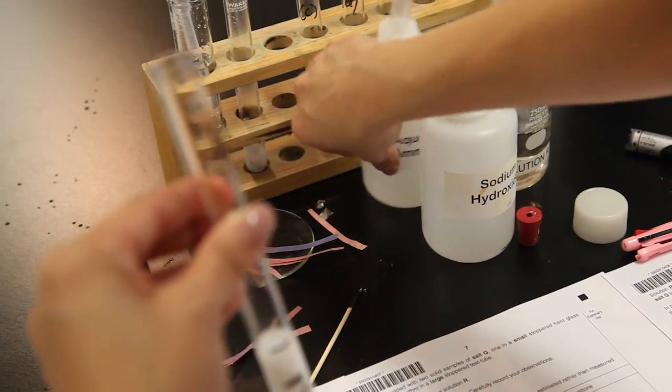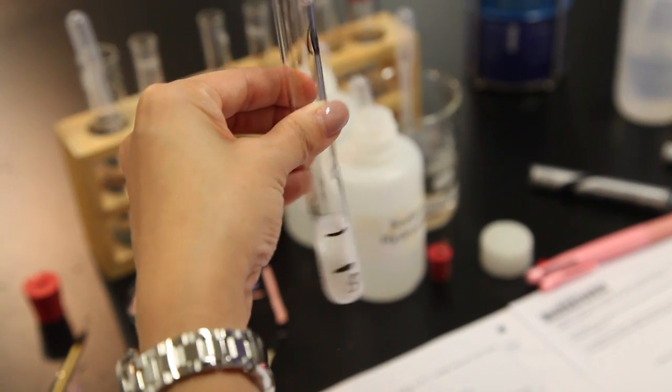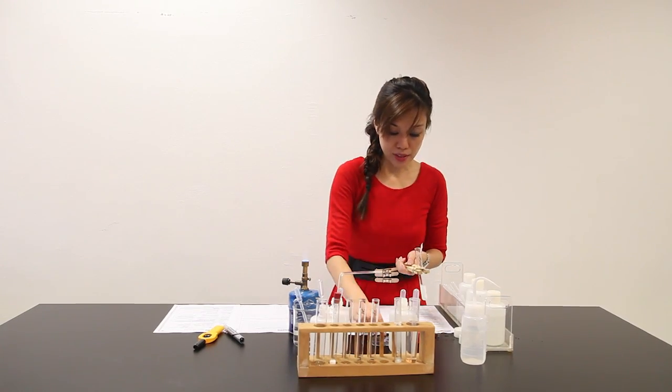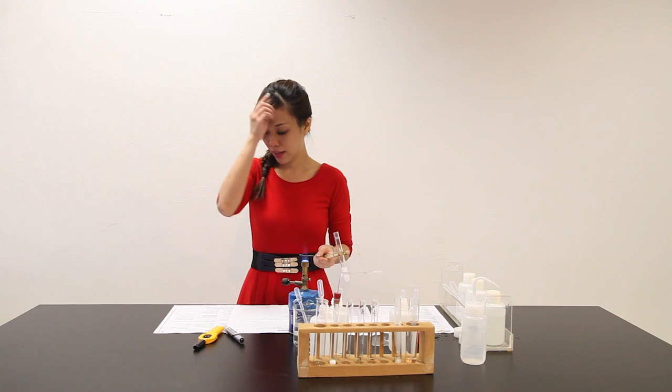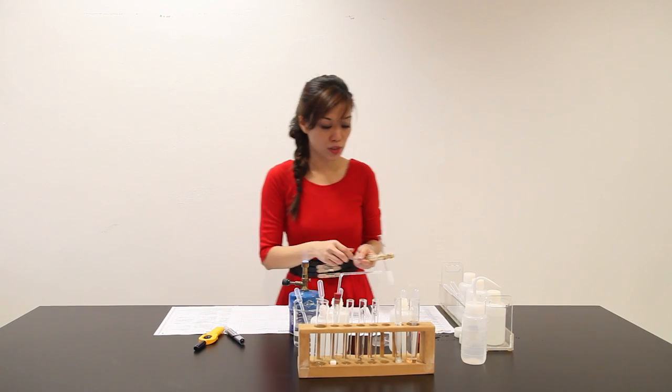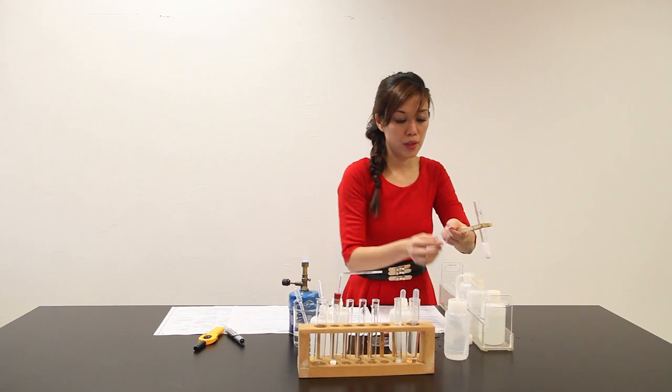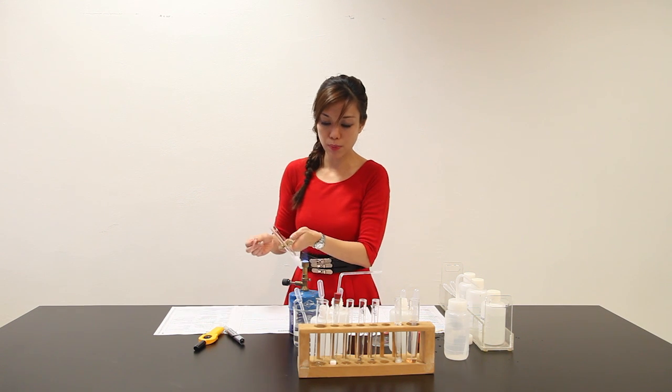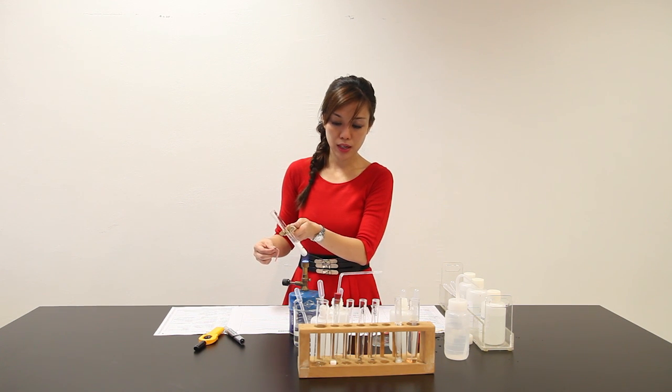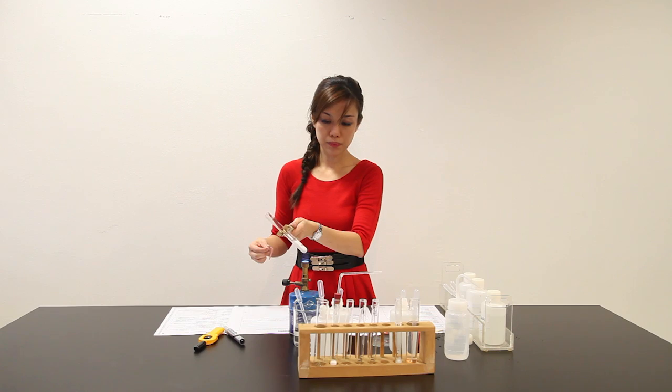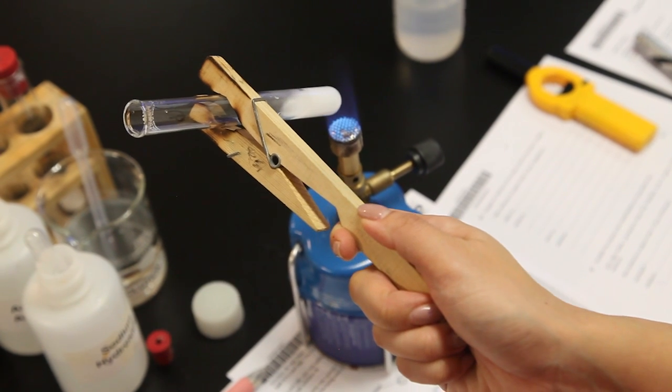The next part says add another 2 pieces of aluminum foil. Right now I'm going to heat it and warm the mixture. This is an anion test to test for the presence of ammonia gas. Because if nitrate is present, ammonia gas will be evolved. I will require red litmus paper. Let me damp it, because ammonia gas will turn damp red litmus paper blue. Let me heat this first. Hold the test tube, heat it, hold it at 45 degrees, heat it gently.